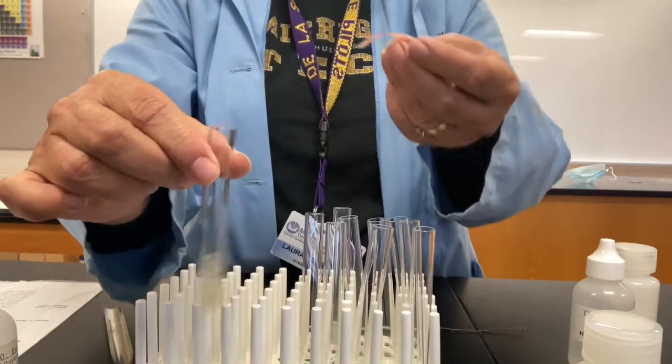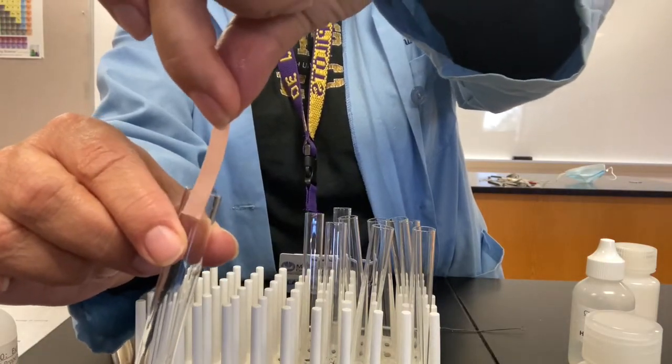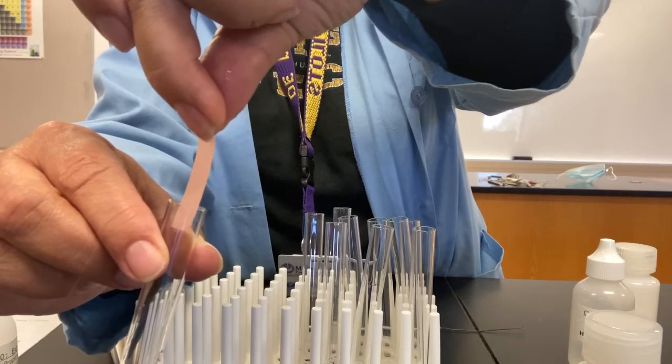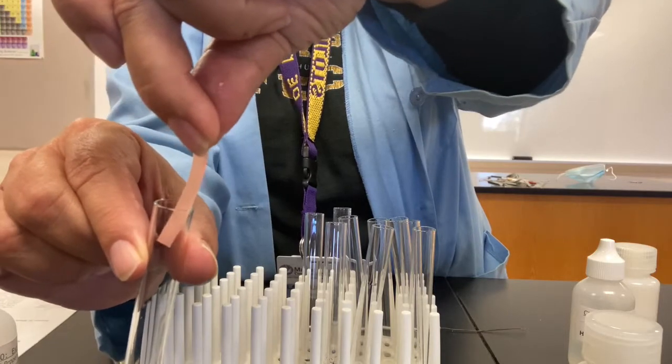I can encourage that to react a little bit, and then I'll put the litmus paper in the mouth of your test tube and wait.